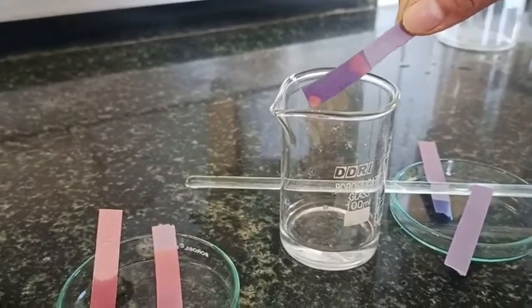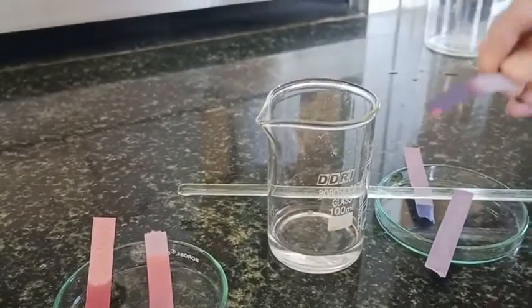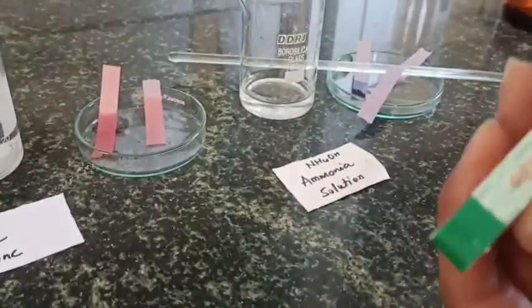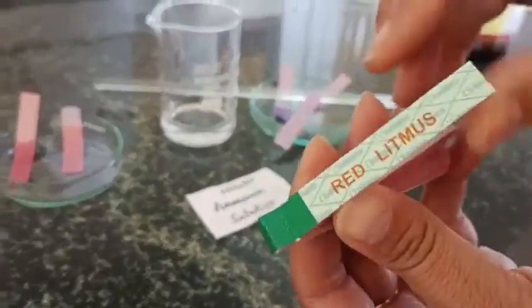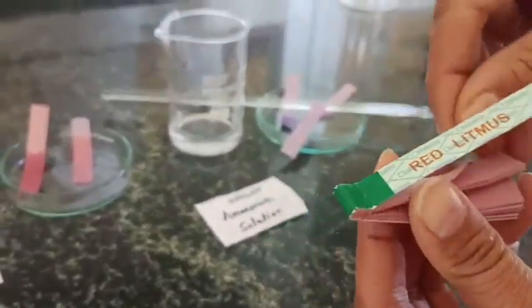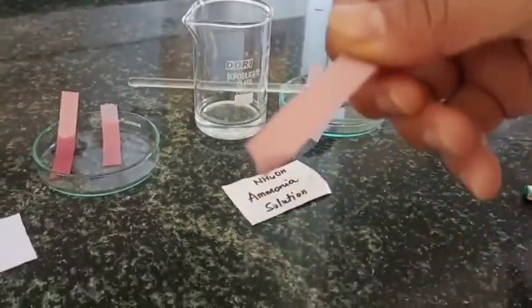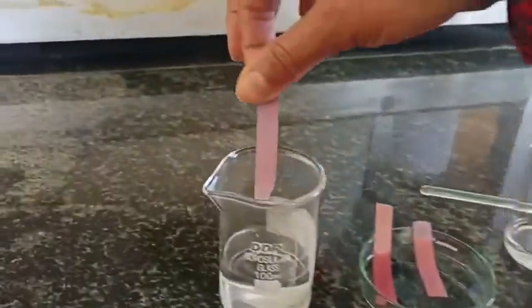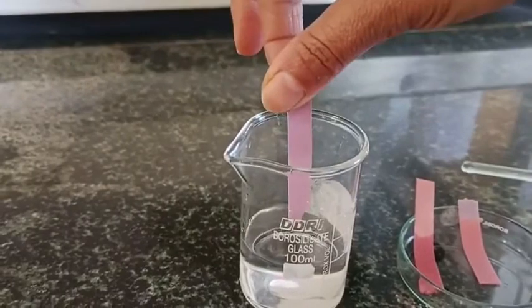The red litmus paper turns blue just by the fumes of the ammonia gas. Here again I am showing it — this is my red litmus paper, I dipped this into the strong acid.